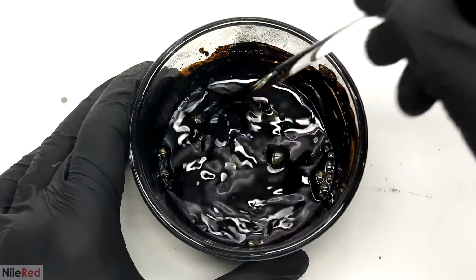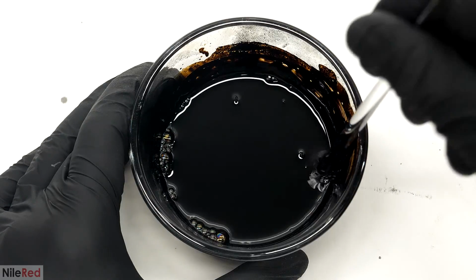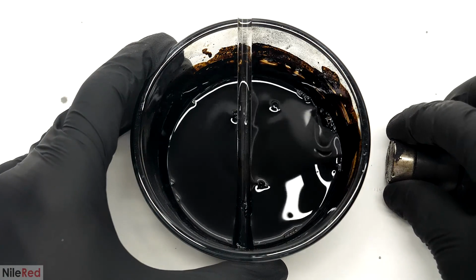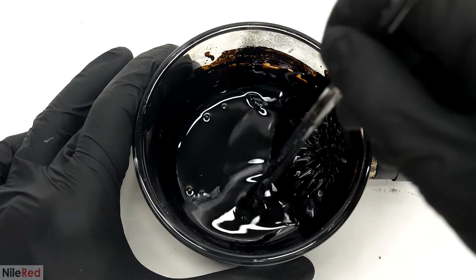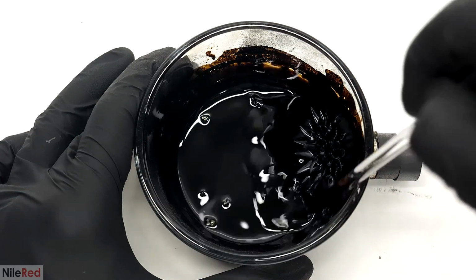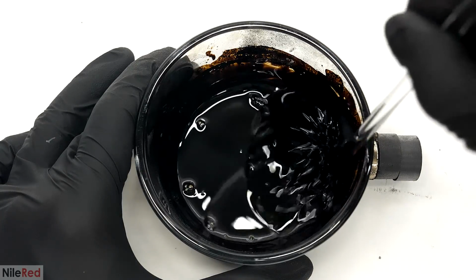When it eventually looked like it was pretty much all gone, I went and got one of my magnets. I found that when there was just a bit of solid left, it could really help, but also, it was just a decent test to see if the fluid was even working. When I brought it close, all the liquid pulled towards it, and it formed some nice spikes, which I was happy to see. Now in terms of mixing things, the magnet helps because it pulls all the solid stuff to one spot. It also holds it there pretty tightly, and it makes it a lot easier to squish it and to crush it on the side of the bowl.